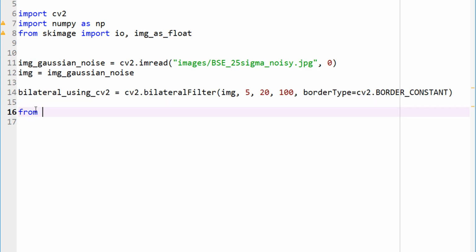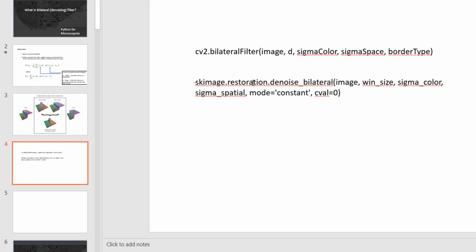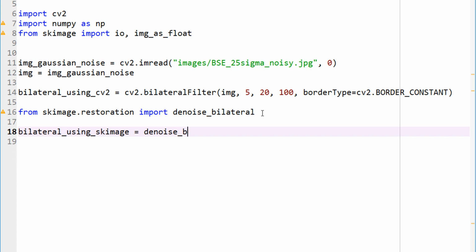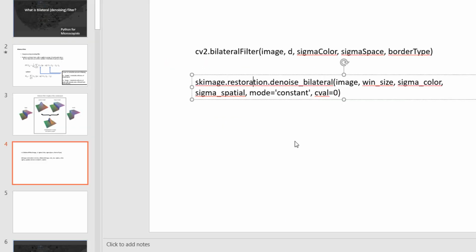Now, how do we do this in scikit-image? From skimage.restoration, let's go ahead and import denoise_bilateral, right? So if I go back to my PowerPoint presentation, skimage restoration, denoise_bilateral. Okay, that's what we are trying to do here. Now, my image, bilateral using skimage, is equal to what? denoise_bilateral. Okay, and what parameters are we going to use? Again, image, window size, sigma color, sigma spatial, and mode.